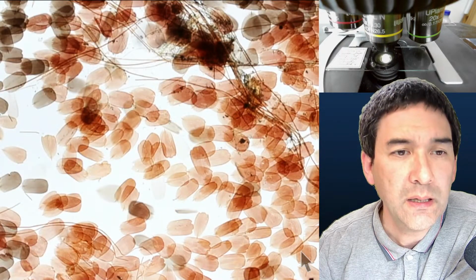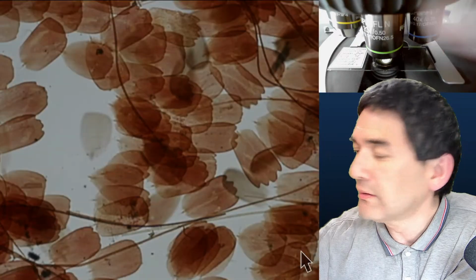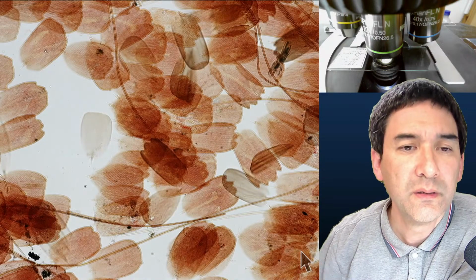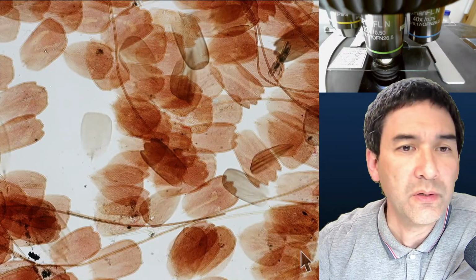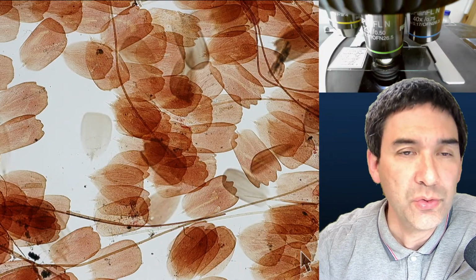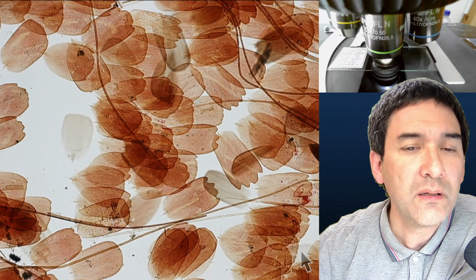Yeah, and here too, I did a little bit of a stitching. Yeah, and maybe in the future, now that I have the new camera also on my stereo microscope, I'm going to maybe do also a video session on stacking using Helicon Focus, which is quite nice. Yeah, veins maybe.